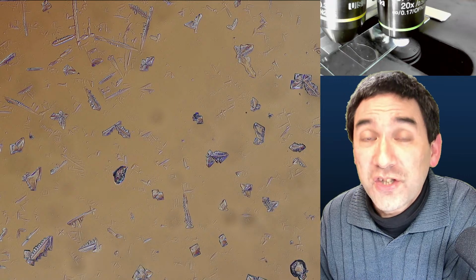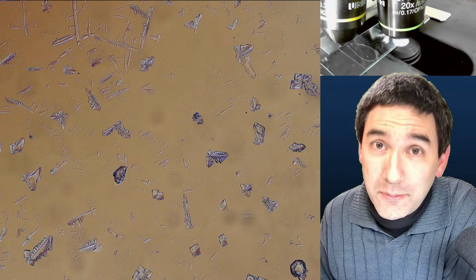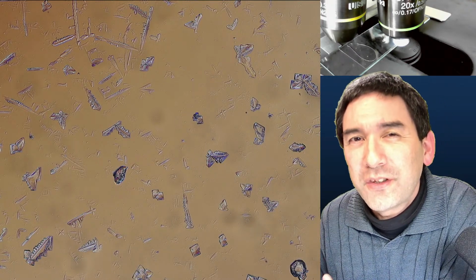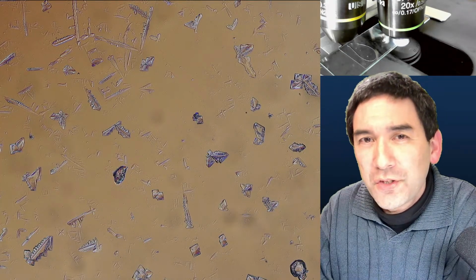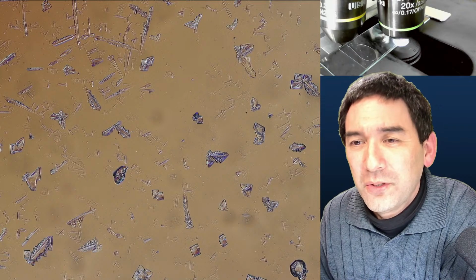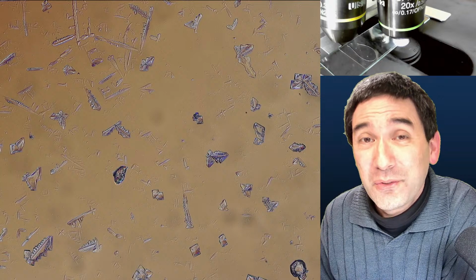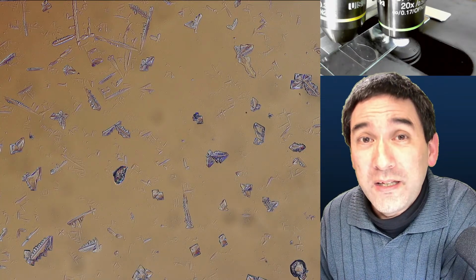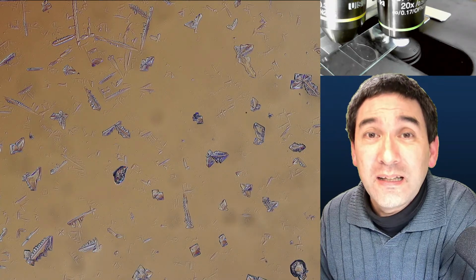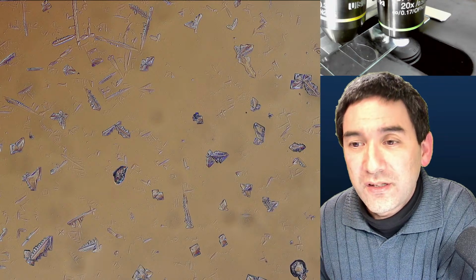So try soy sauce as well. I made a video as well. Soy sauce also works quite nicely, and table salt also works nicely. I think the crystals from pure table salt are not that interesting because they're just square, but if you experiment around, you're also able to do that. Sugar will also crystallize, but it will take a very long time. You have to make a very syrupy sugar solution by heating up the water sugar mixture in a microwave, and then allow it to evaporate. It usually takes a couple of days, and then you also will get crystals.